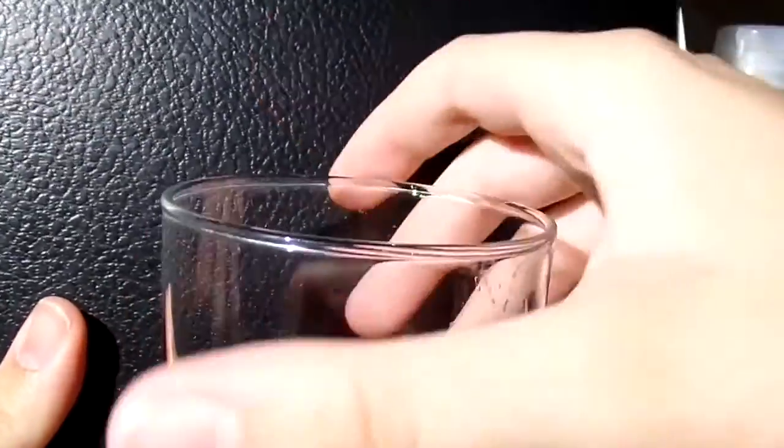I've used my sketchbook because it has a dark background so you can see the DNA form. What you are going to see when your DNA is extracted is these little wispy clouds or strands.